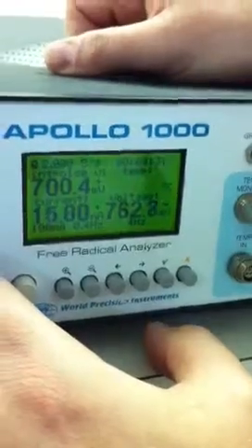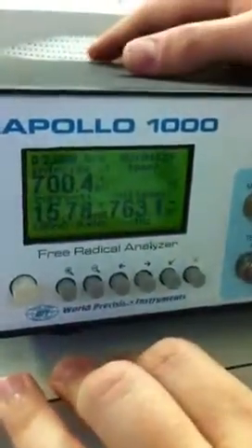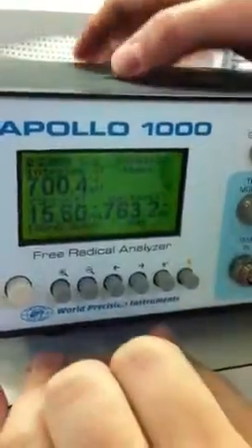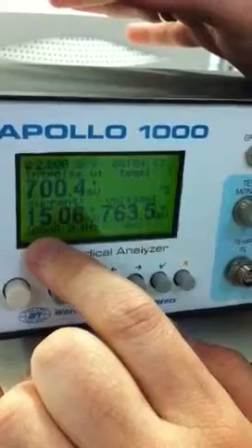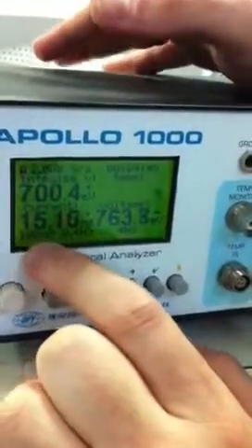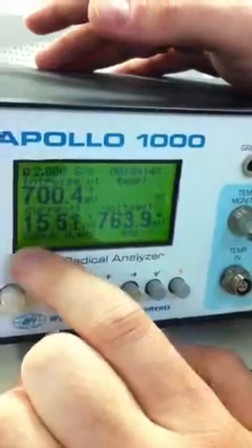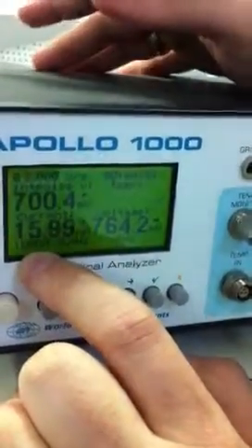And so now, for NO, what would I set it at? For NO, depending on the type of sensor and temperature you're working at, it would normally at room temperature be in the 10 nanoamp range. Versus 100 for oxygen. Right, but if you're going to work at an elevated temperature, you might have to move to a 100 nanoamp range because the baseline current will increase with temperature.